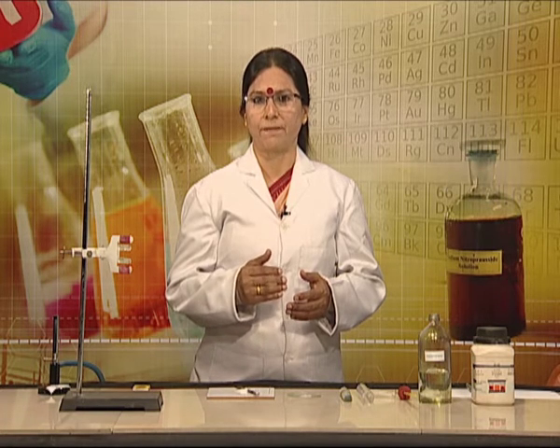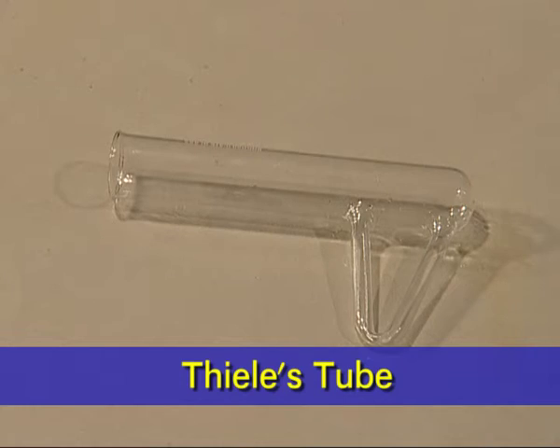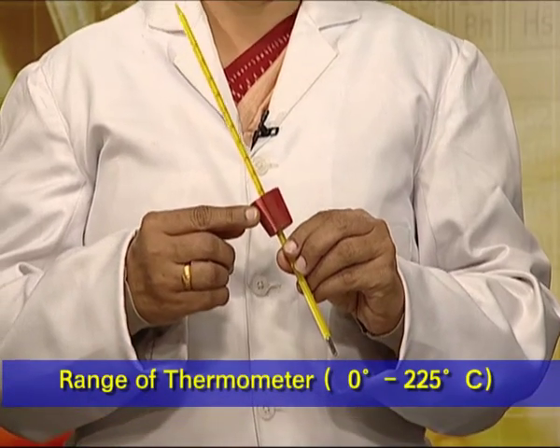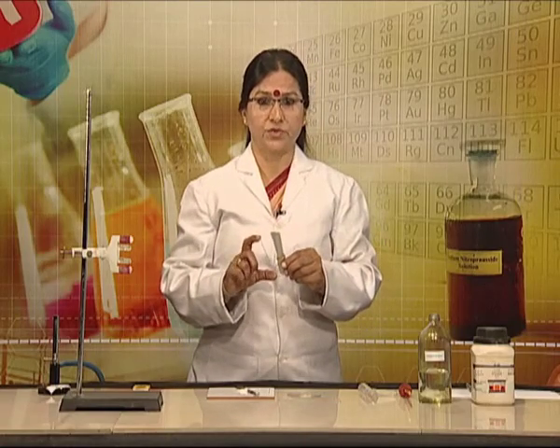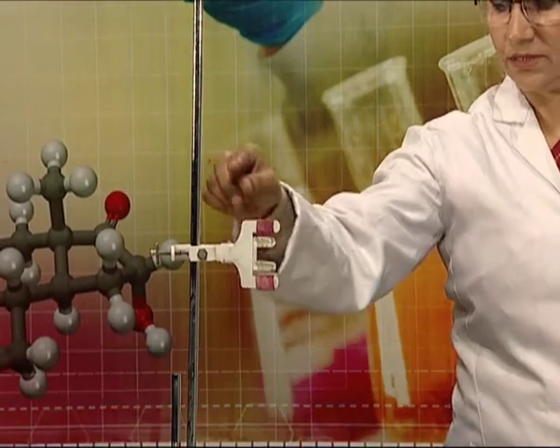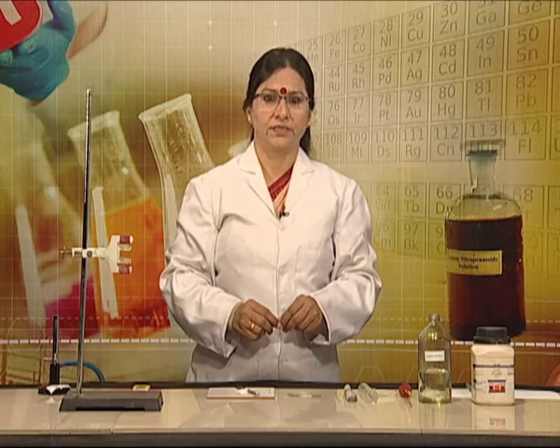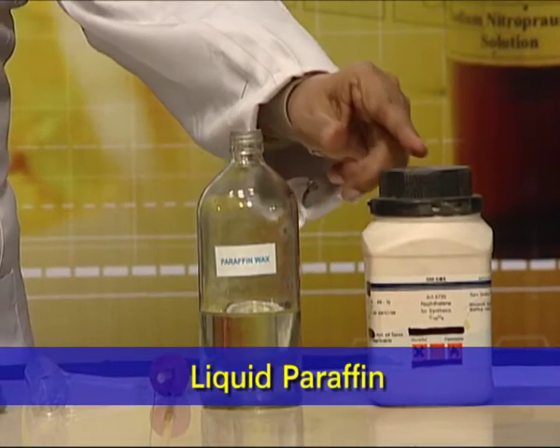Materials required to determine the melting point of a solid organic compound are: Thiel's tube, thermometer, cork with side groove, capillary tube, and iron stand with clamp and burner. The chemicals required are liquid paraffin and the organic compound.